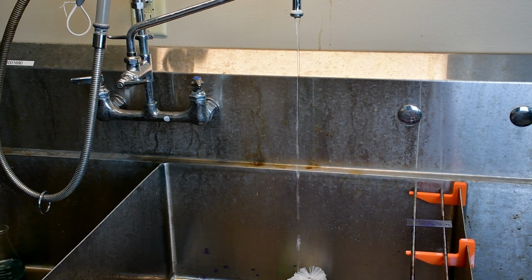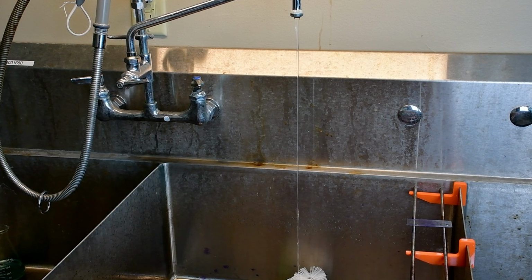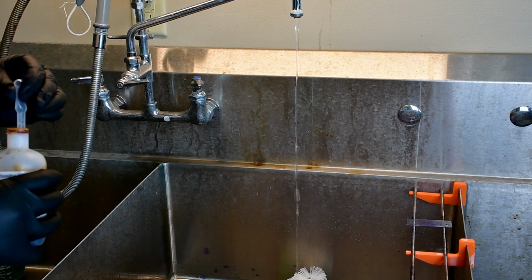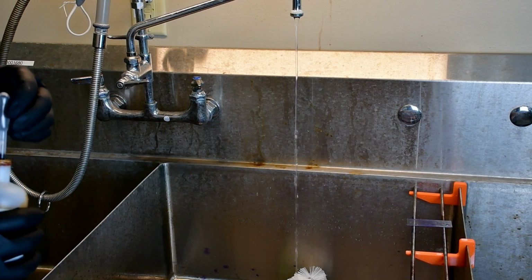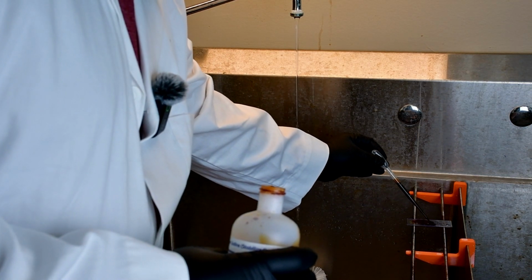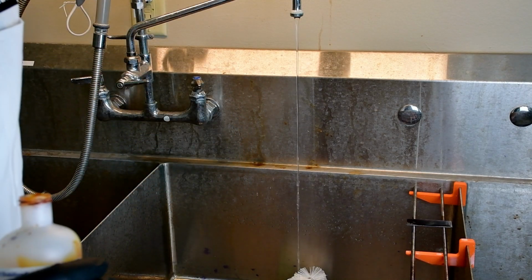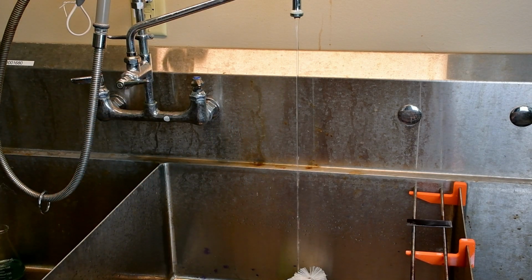But after the gram stain, I'll use the gram's iodine, and that's going to react to the stain, locking it into cells and filaments that are prone to maintaining that stain. And you'll kind of see what I mean a little bit later. I'll explain. So I'm going to add that on, fully covering the slide again, and then starting my 1 minute timer and letting that sit for 1 minute.